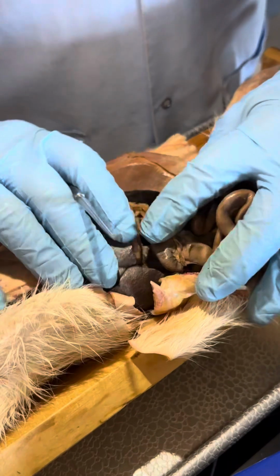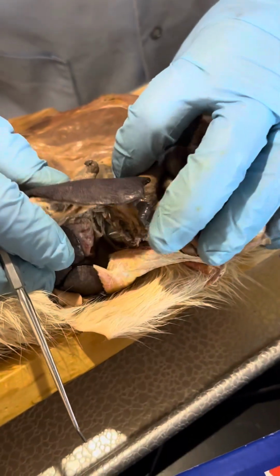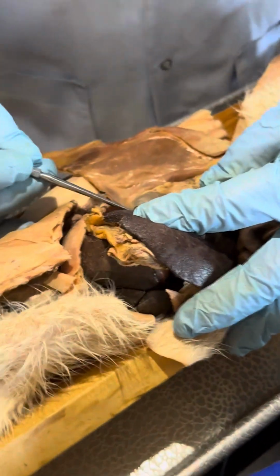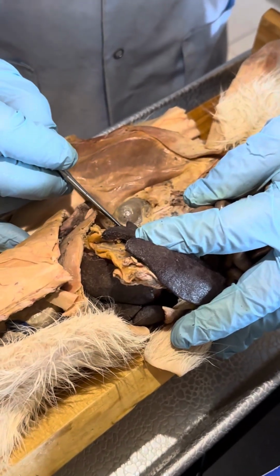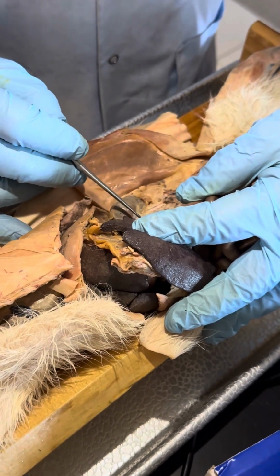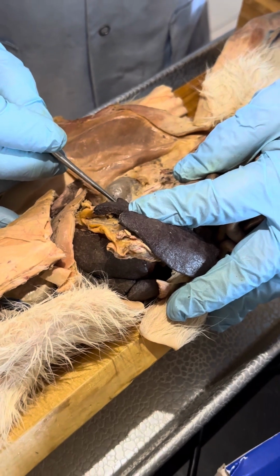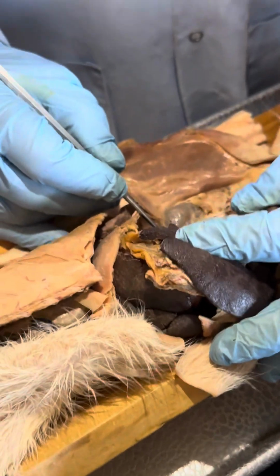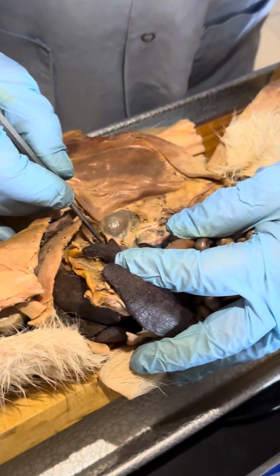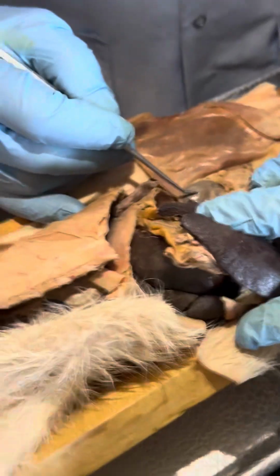All right. We have the kidneys. And the kidney is a kidney-shaped organ. And then if you look cranial and medial to the kidney right here, there's a blue vessel. See the blue vessel here? There's a small organ on either side of that, about the size of a lentil. That little piece right there would be the suprarenal gland. So in a human, the adrenal gland is on the kidney. But in a cat, it's not on the kidney. It's cranial and medial to it.